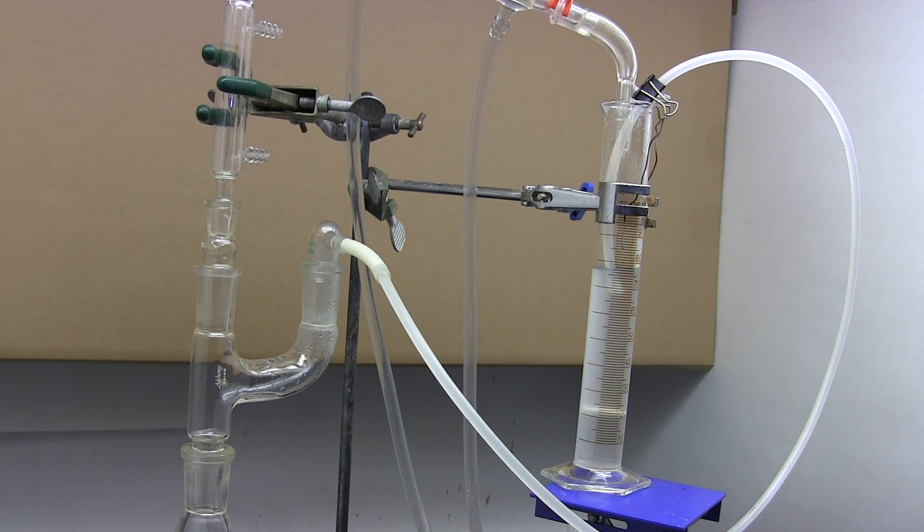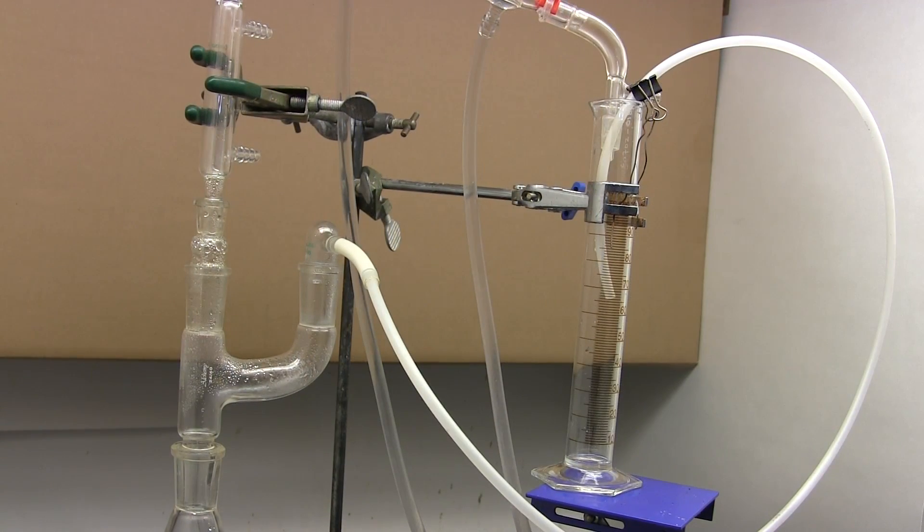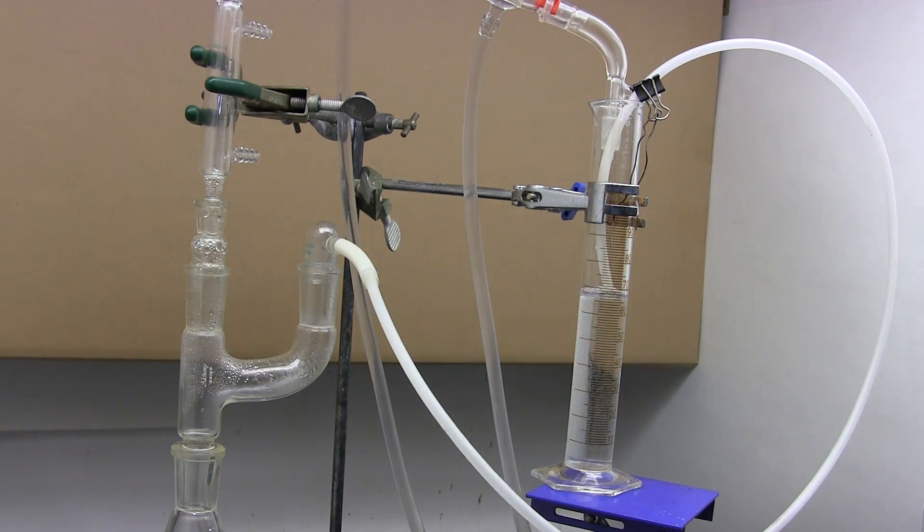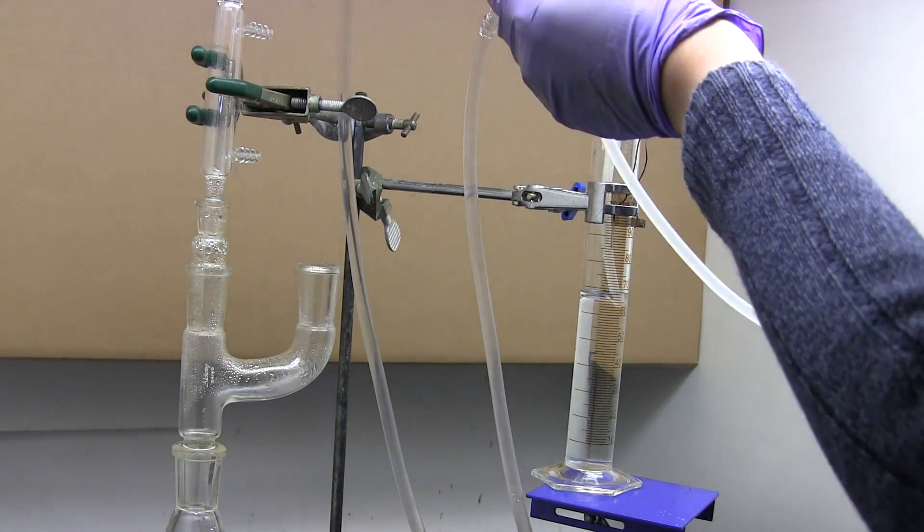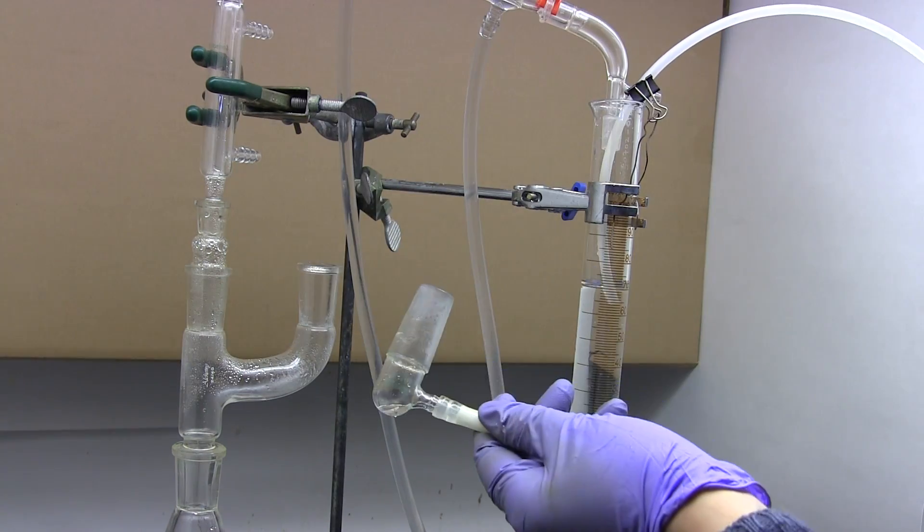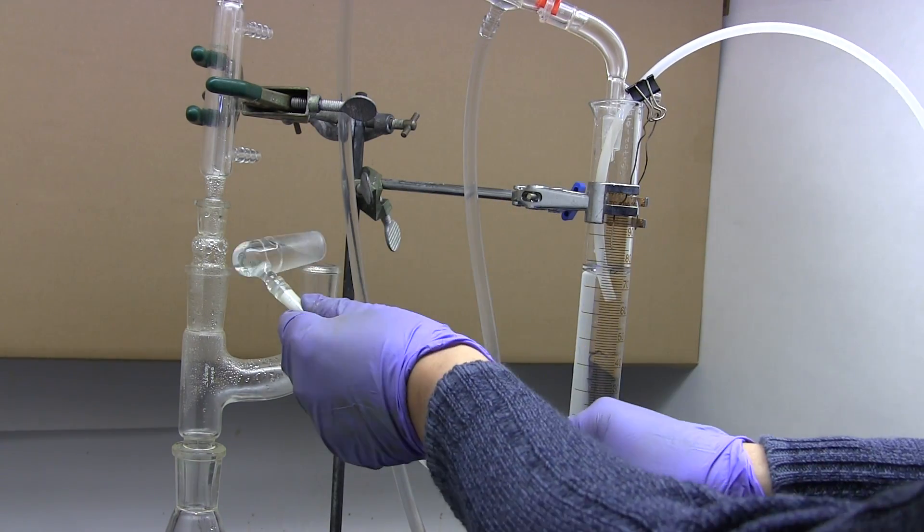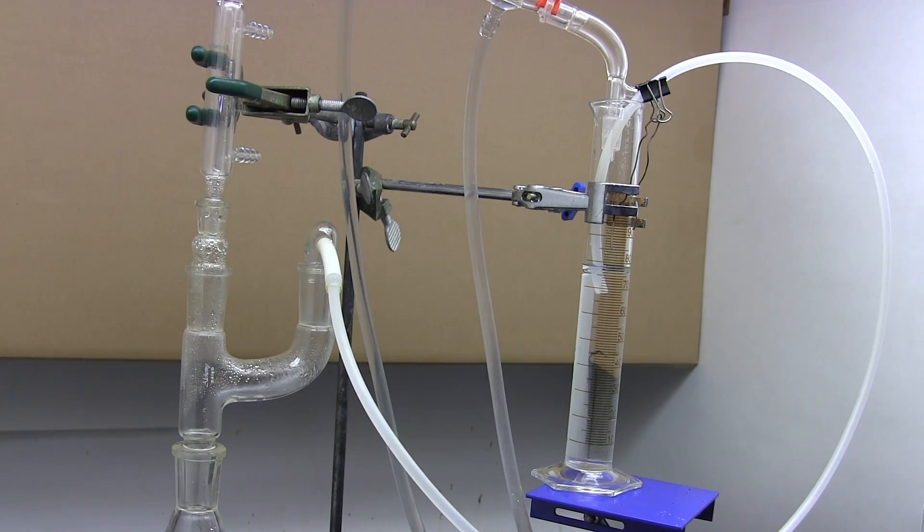Fortunately our homemade unit can be easily modified for heavy return. So I've emptied out the cylinder and tube and just like with the light return mode, we make sure all the tube positions are where they should be and we fill this time with water since that is our carrier fluid and our target is the lighter oil.